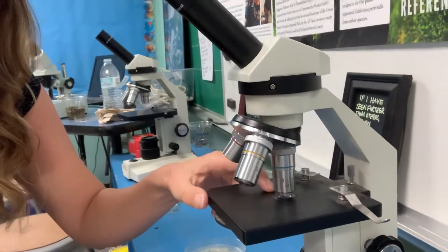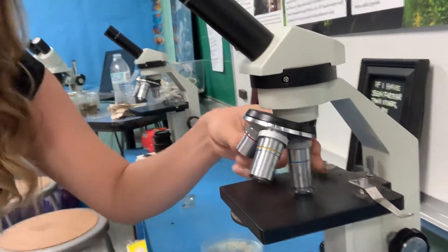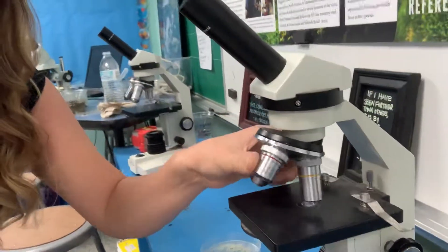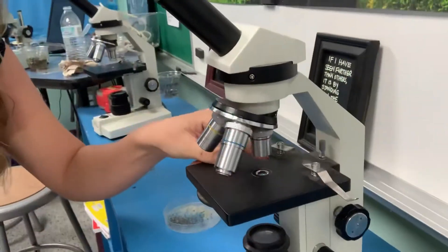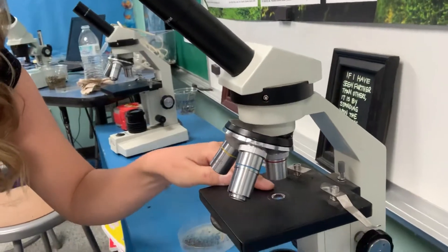So you can't just put your petri dish down here because it'll get into the water. You can look for tardigrades with a compound scope — just make sure if you are, you're at the least magnified lens.